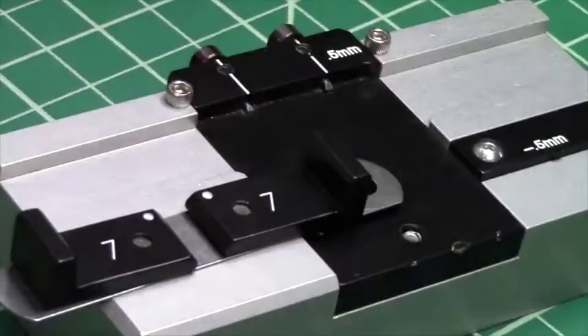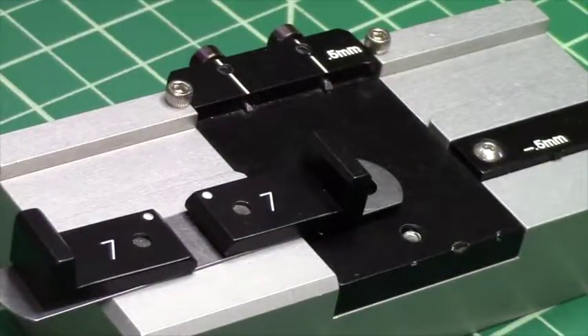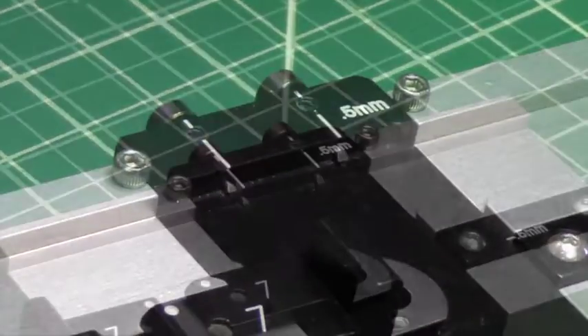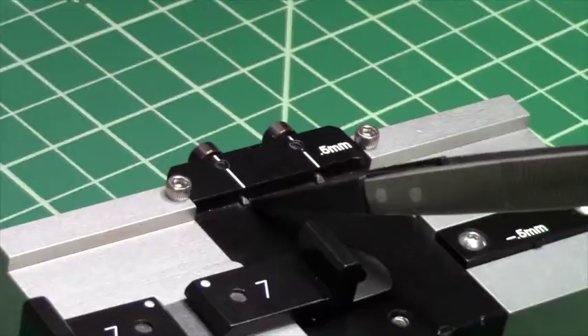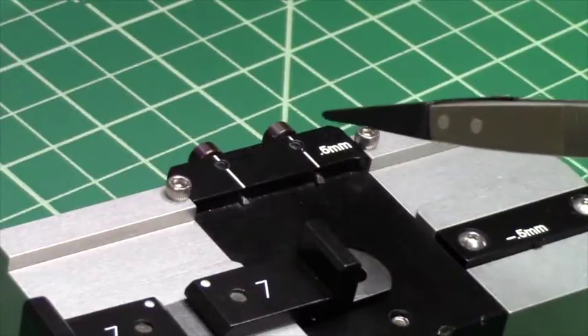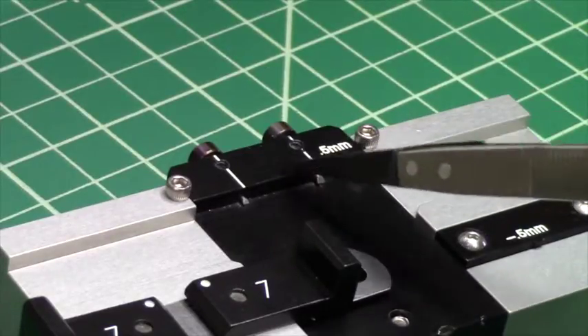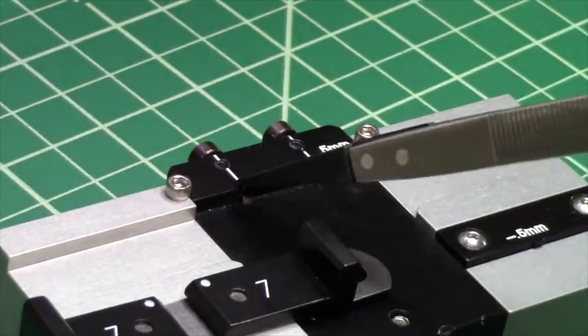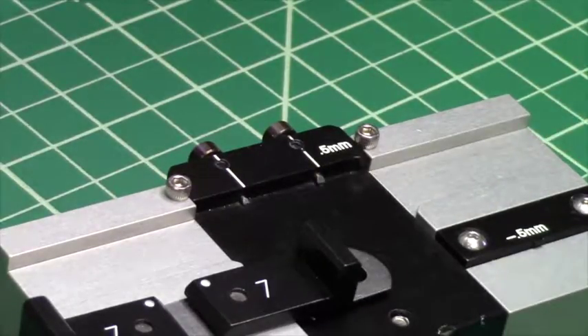Here is the hold down with the white dots. We can zoom in on the cleaving pins — these are the cleaving pins that we're using as our leverage point for the cleaving, and we typically use the small pin.